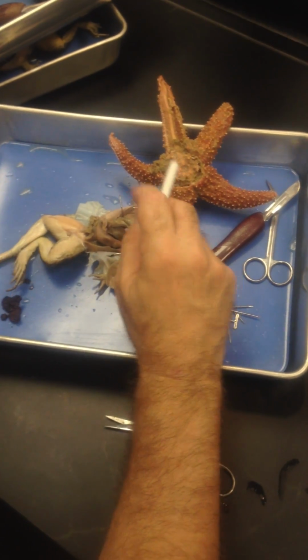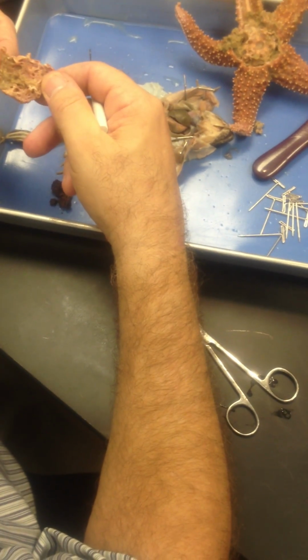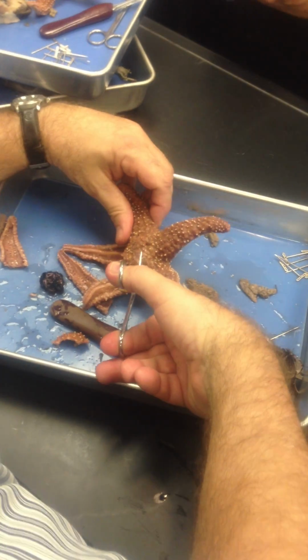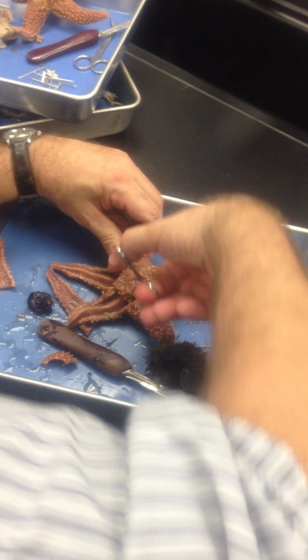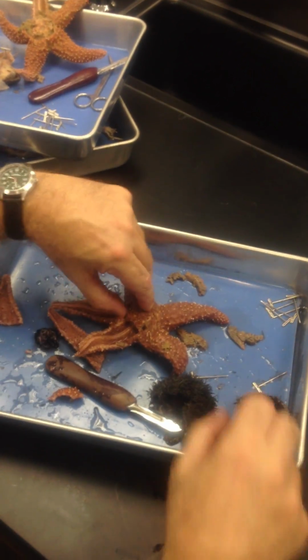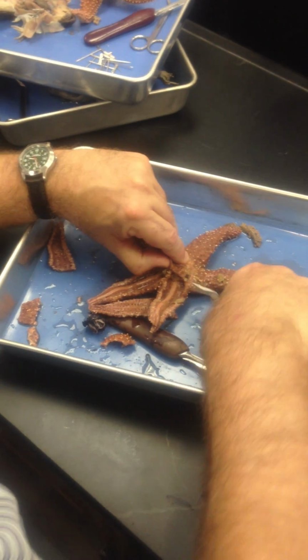This guy. Okay. Give me 1 second. I still may have to go in here, because I've got to show you the pyloric stomach. Remember, I think I crushed it, but that's okay. We won't hurt you too badly on that. But at any rate, remember they evert the stomach. Once the bivalve mollusk is open, they evert that stomach. Let me show you the stomach.